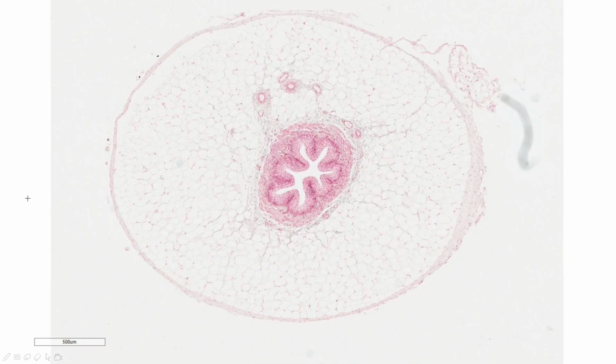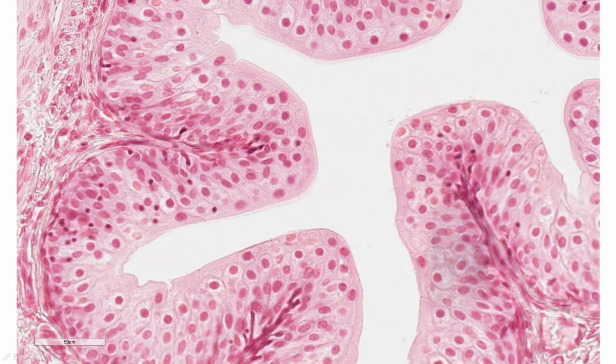Transitional epithelium is also called urothelium because it is a specialized stratified epithelium found in the lower urinary tract. It rapidly adapts to distension and contraction by changing from a taller to thinner epithelium. This tissue section is an example of a ureter, which is lined with the transitional epithelium. From this view, this tissue kind of looks like a sand dollar. When we zoom in, you can see several layers of cells and also the large dome-shaped umbrella cells on its surface. This tissue would look much different if it were stretched, but since we don't have an example to show you, then we won't worry about it.